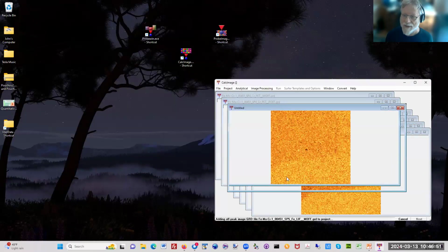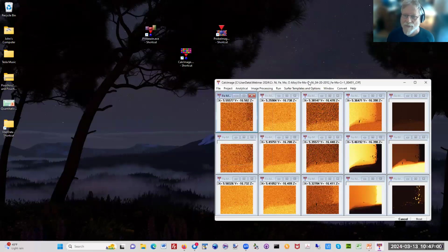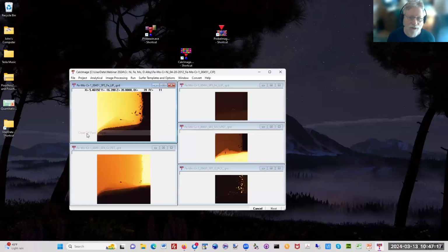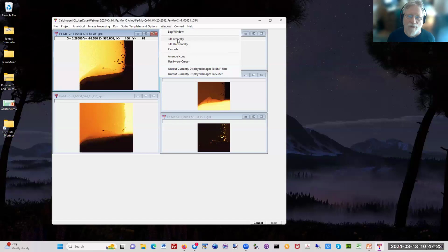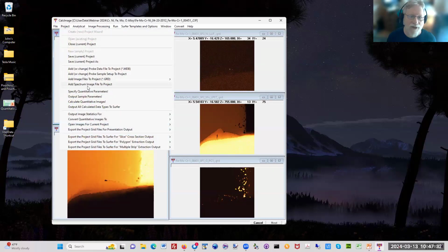And here it loads in the raw data. Here are the raw data maps. And it now tells me that I would need to go to this project, specify quantitative parameters menu, to assign each map to each element. And typically what I like to do at this point, you can see that in the off-peak maps you can see some of the compositional effects, the effect of average Z here. But what we're mostly interested in for the quantification at this point is we can close the off-peak maps and we can see the on-peak maps, which is what we really care about. And if you look here, the Z here is in counts per second right here. And now what I'm going to do is go to this project menu here.